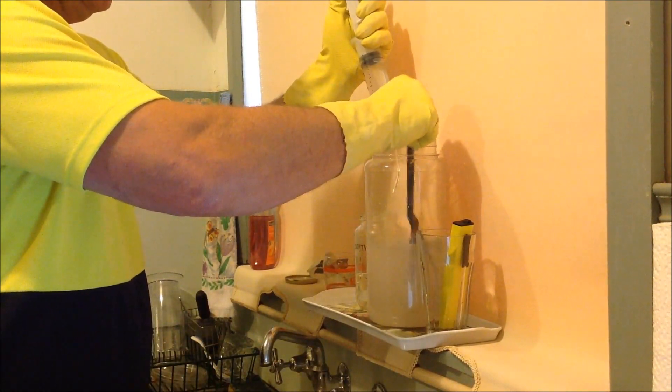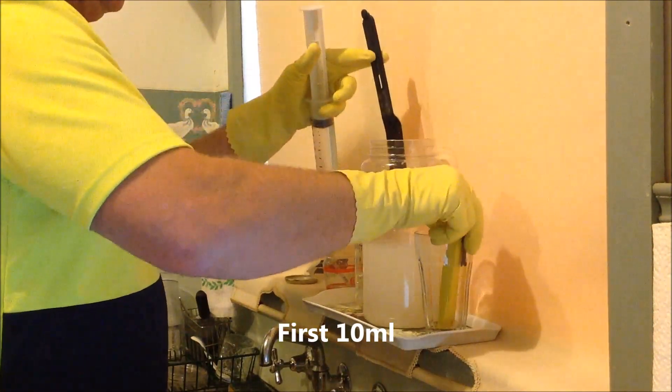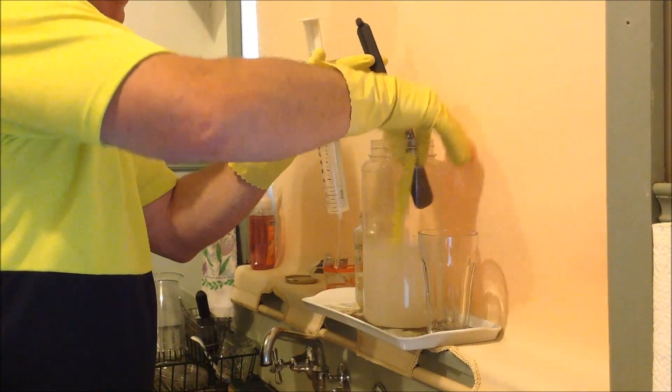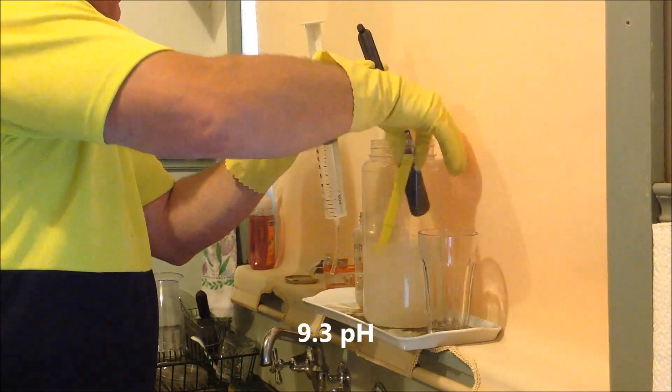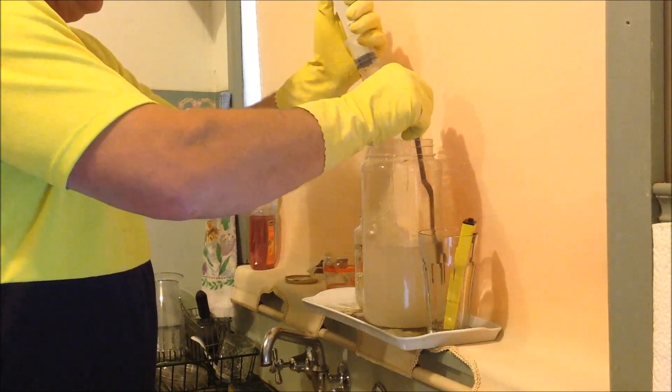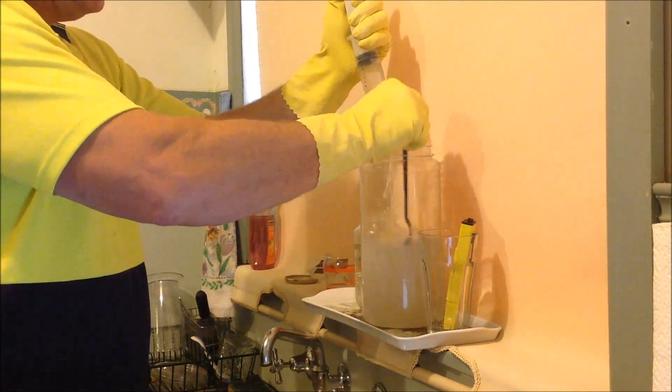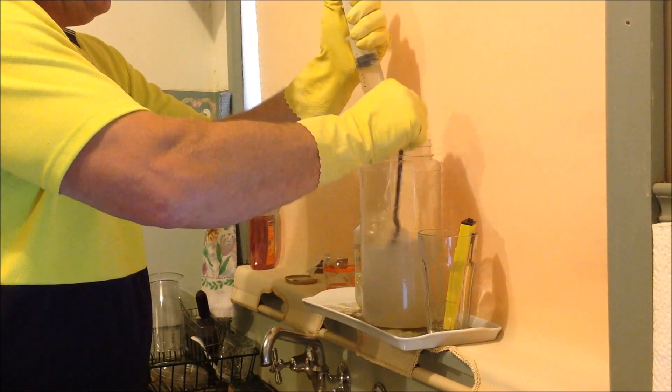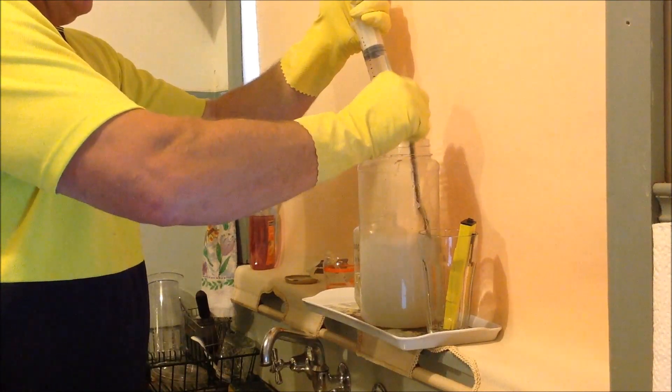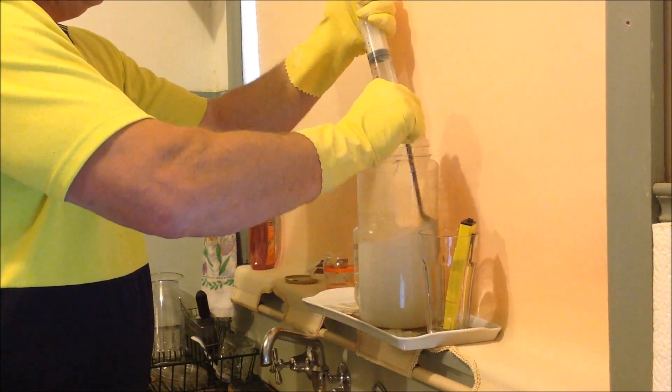So I'm going to pull this down to even just 10 ml and just take a reading for you. We really should have been designed with three or four hands. I'm even making my own mechanical stirrer which I'll use. So this is 9.3 already. You will find that it will approach a resistance. We're taking this up to about 10.7. So now I'm just going to take this down to 50 ml in the solution. Don't just stir it all in one direction. Change direction occasionally, mixing up properly.